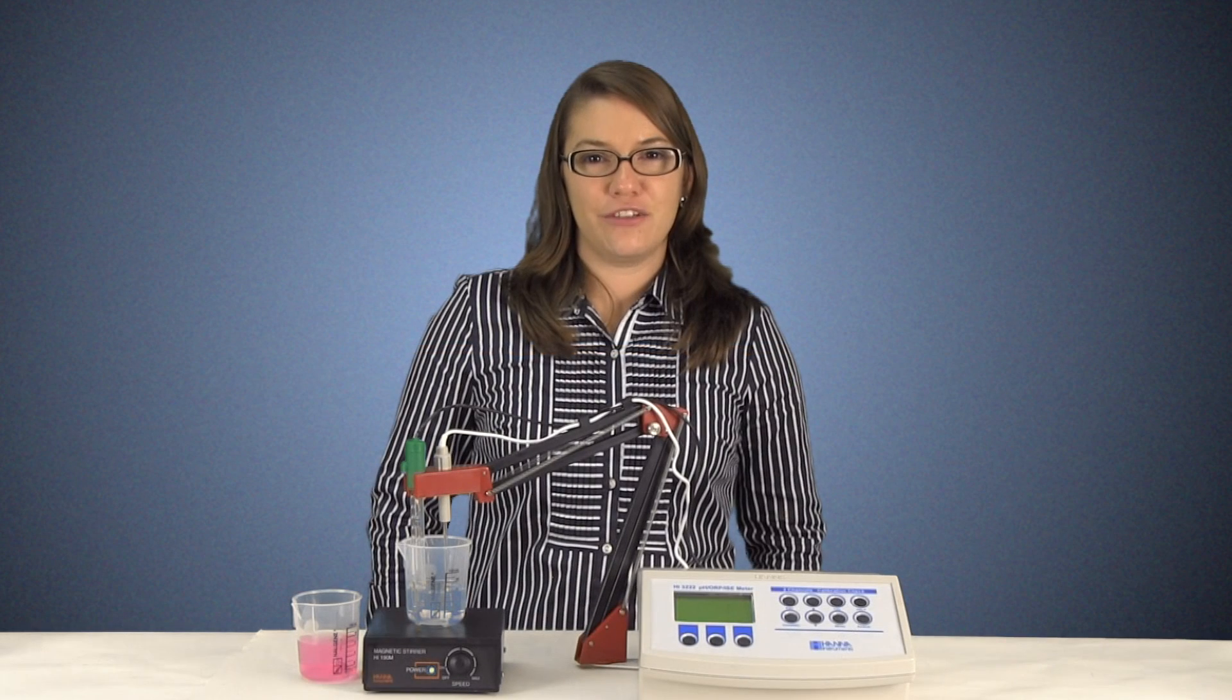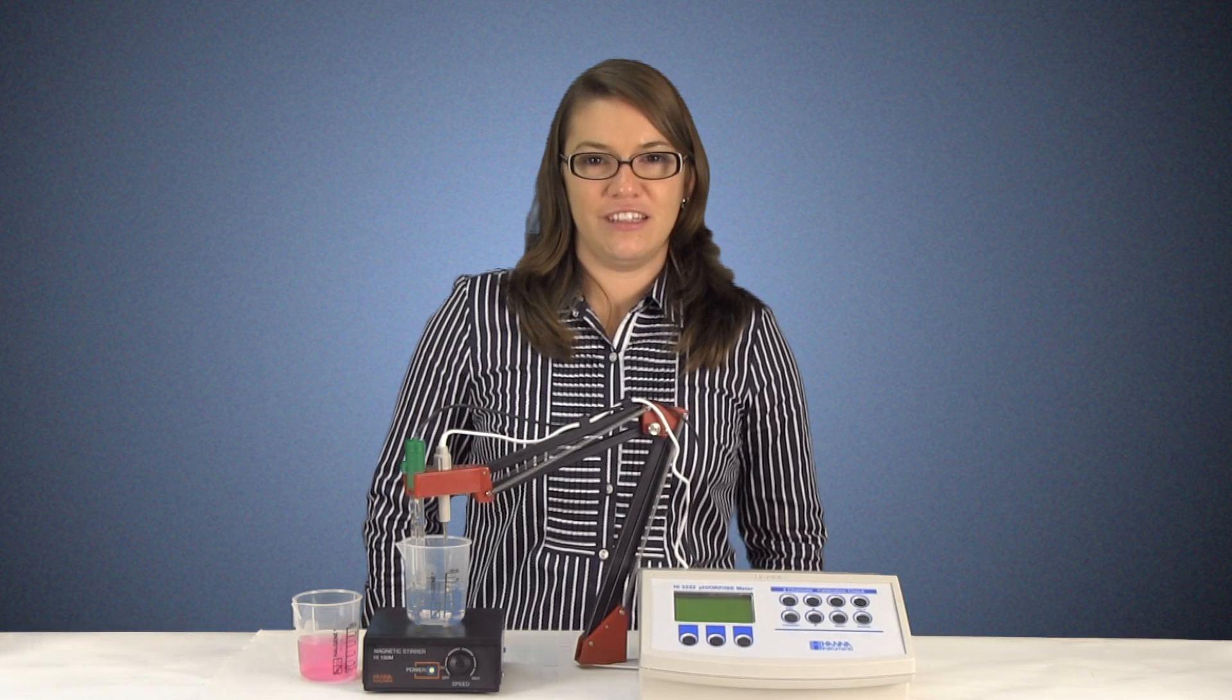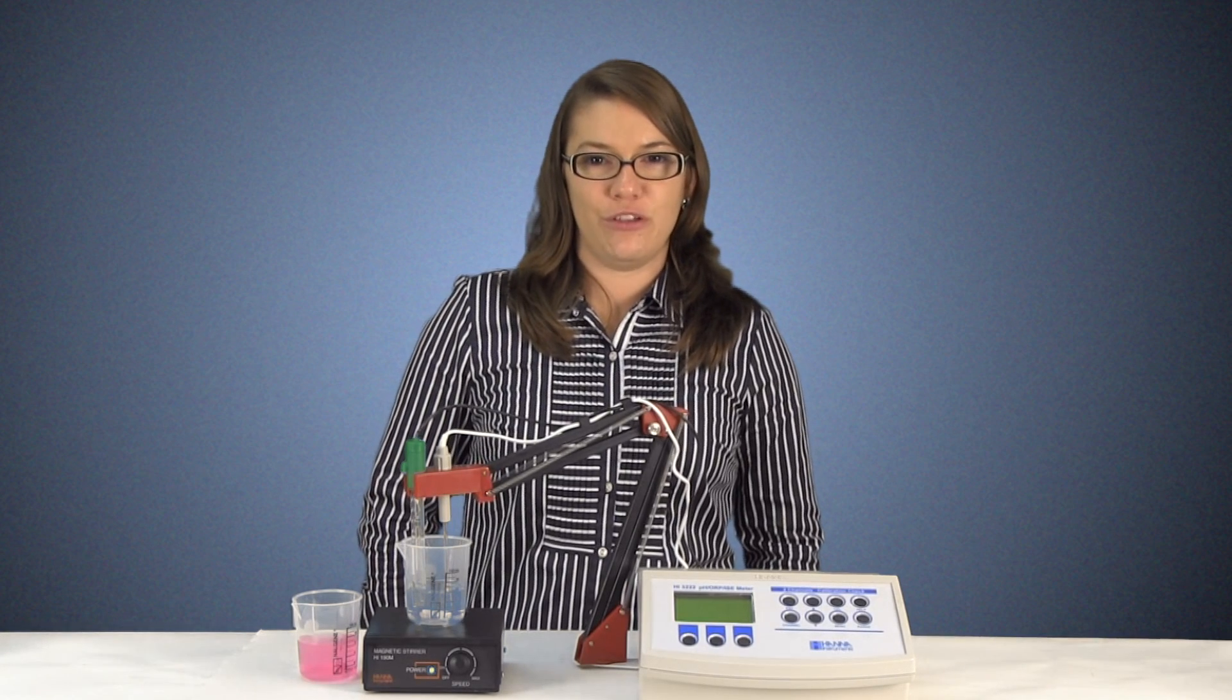If your pH electrode meets both these criteria, then you have a functioning electrode and you can proceed with calibration and measurement.